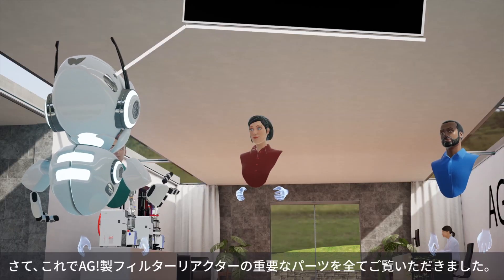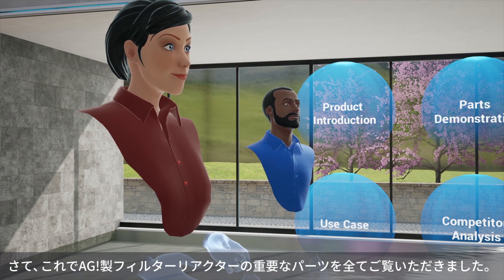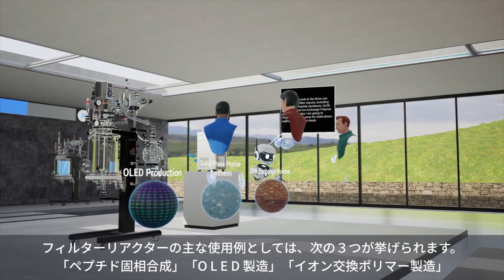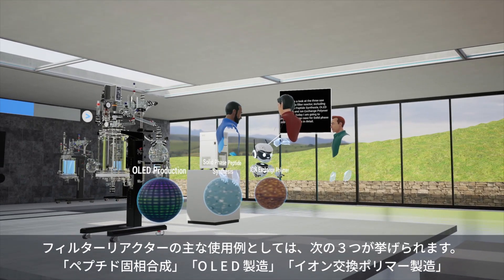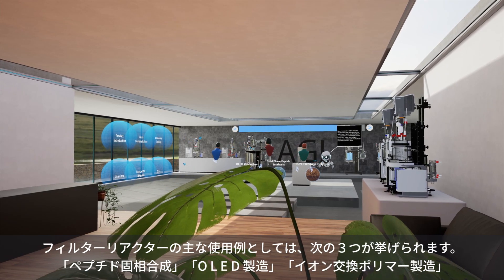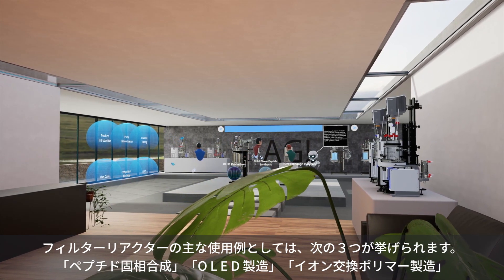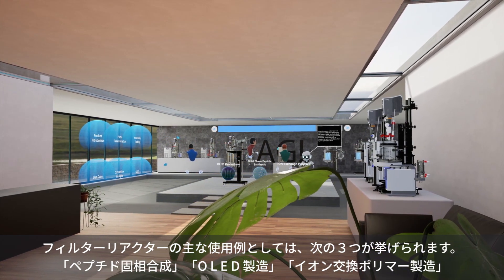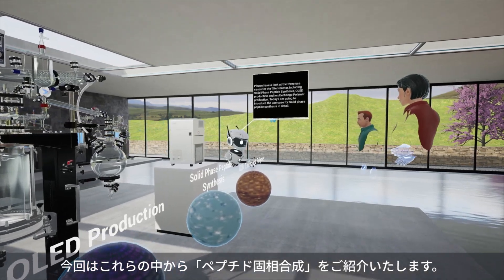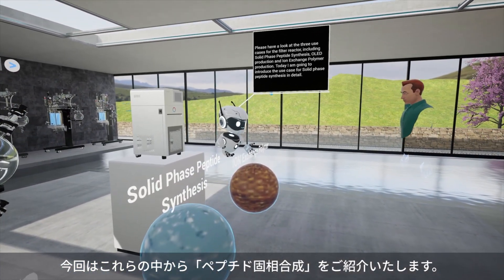Now you have seen all the important parts in the AGI filter reactor. Please have a look at the three use cases for the filter reactor, including solid phase peptide synthesis, OLED production and ion exchange polymer production. Today I am going to introduce the use case for solid phase peptide synthesis in detail.